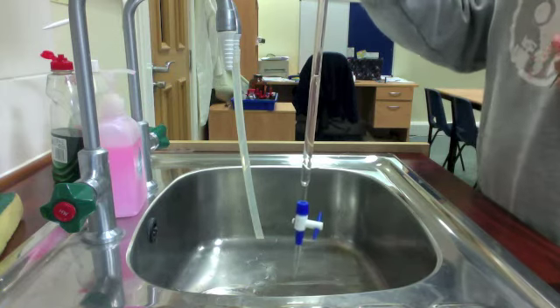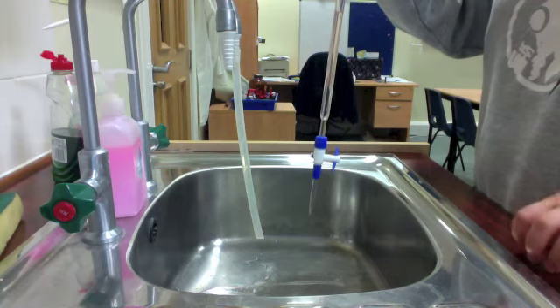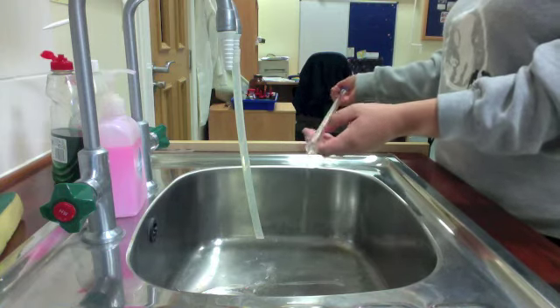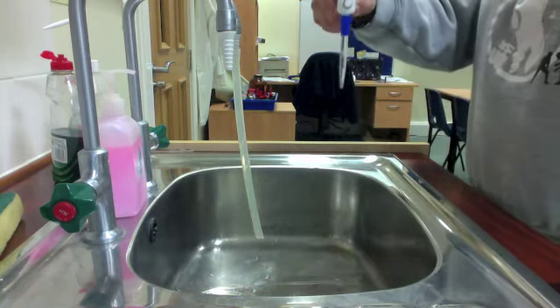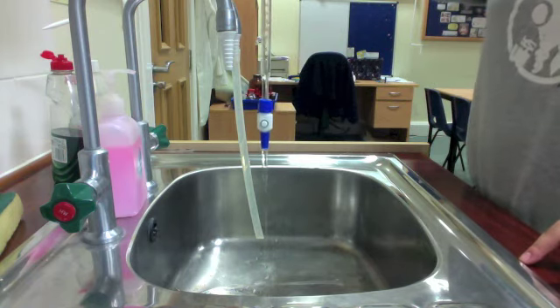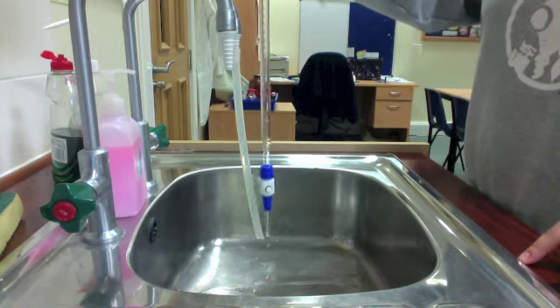Then I want to make sure I rinse the burette so that this distilled water touches all the walls of the glass and is able to capture any ions that might be left behind. So I'm just going to turn it horizontally over the sink and rotate it. We can have a little bit pour out there. The other thing I want to do is make sure that the distilled water runs through the tip of the burette so that gets analytically cleaned out as well. So I'll simply open the stopcock, let the water run out, and make sure it all runs out.